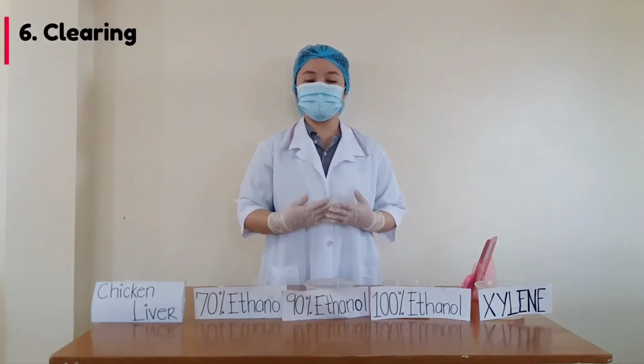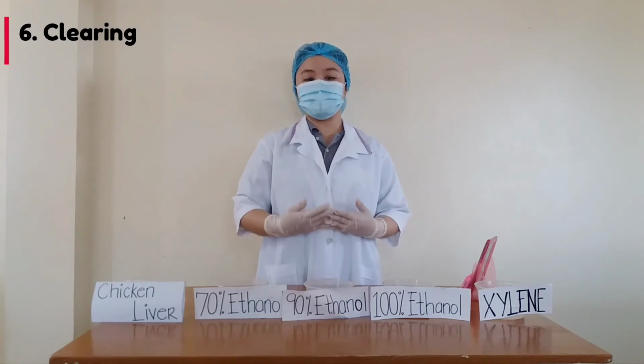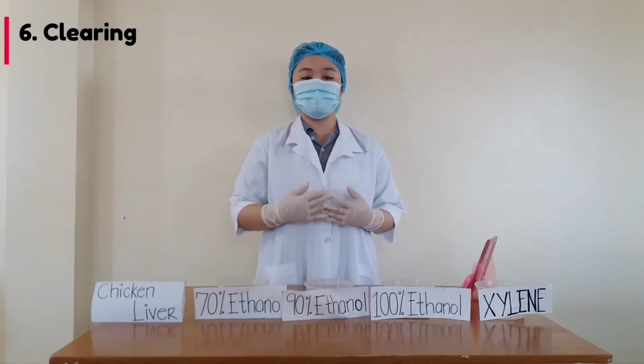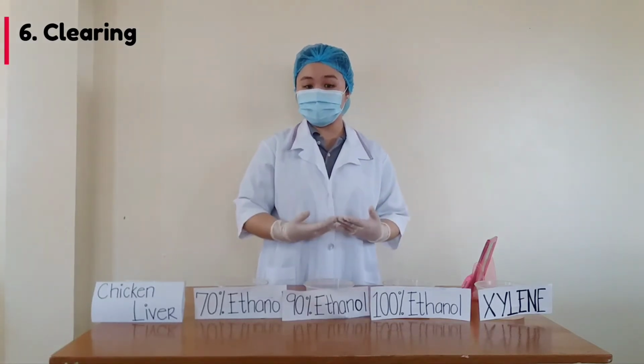Clearing is an essential step in histopathology processing for light microscopy. The purpose of clearing is to remove dehydrating agents from tissues and to prepare the tissue for impregnation with our embedding agent, which is our paraffin.